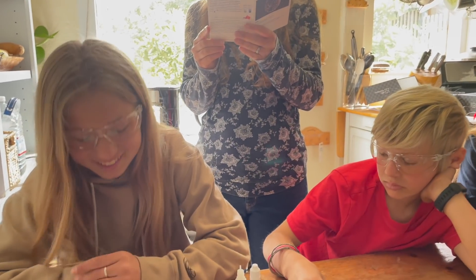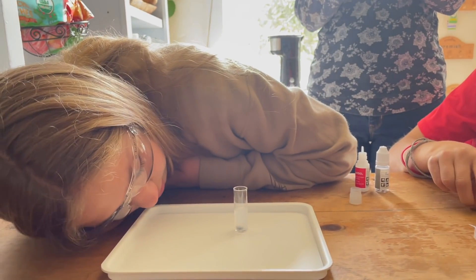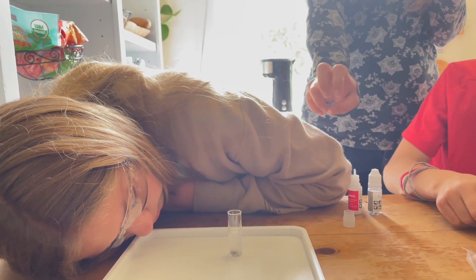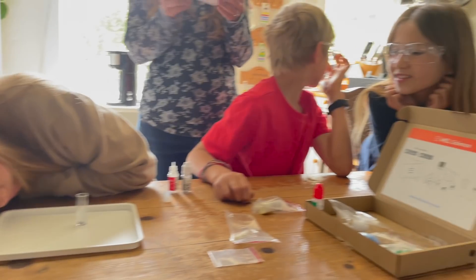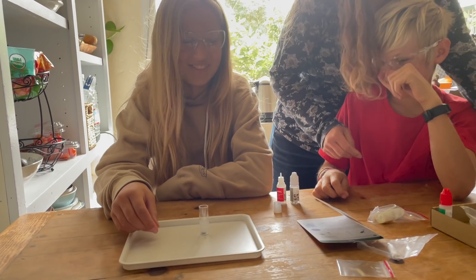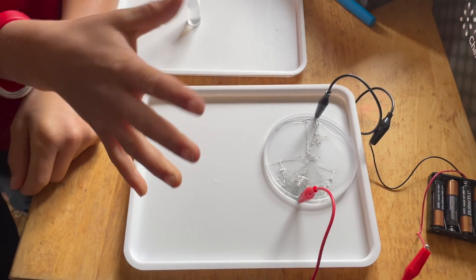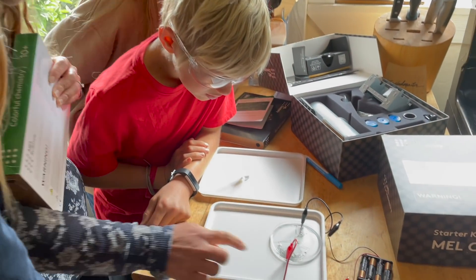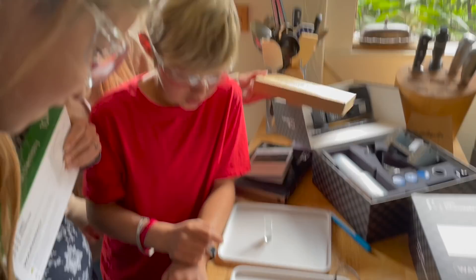It's supposed to be a baby hedgehog thing. How big does it grow? Not too big, but it's pulling like an electron blanket over that from the solution, turning into metallic tin, and it ventures out into the solution. That is so cool. Look at how much more it grew — it's grown like a forest. It looks like shattered glass. Remember it said it would disintegrate if we left it? I think it's pulling the ions — it looks like it's melting it.